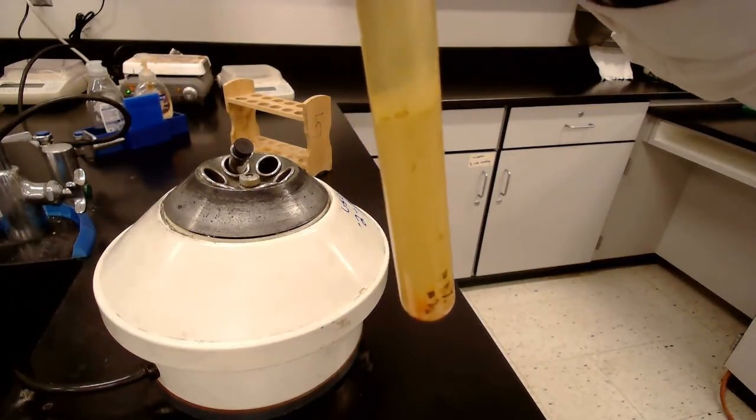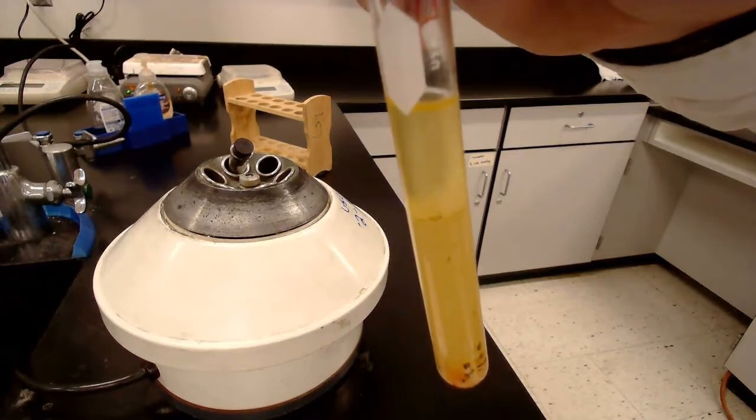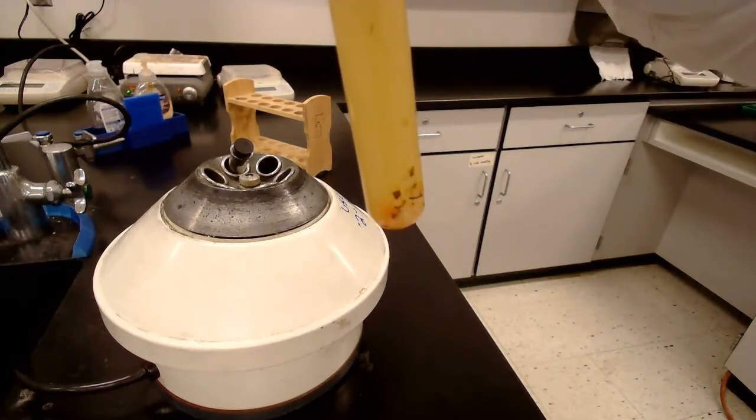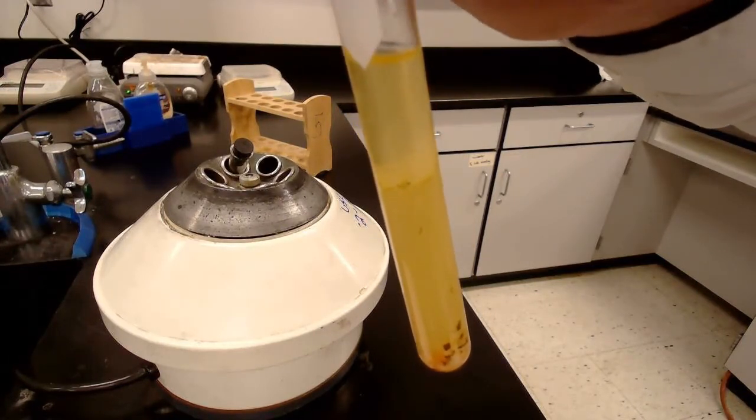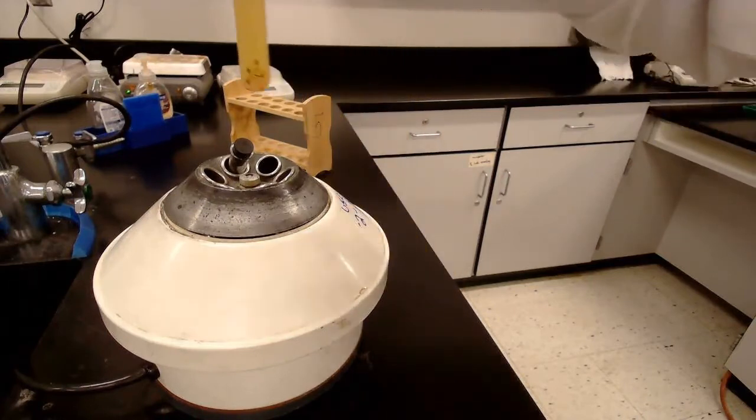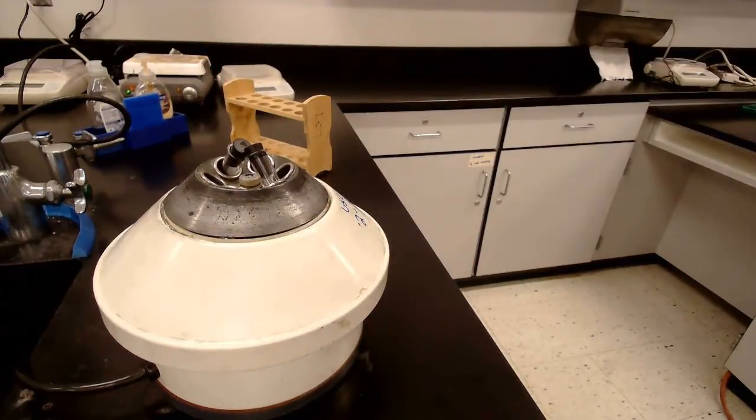So, pause or rewind the video and try to draw this color on your paper. That is the basics of how to use a centrifuge.